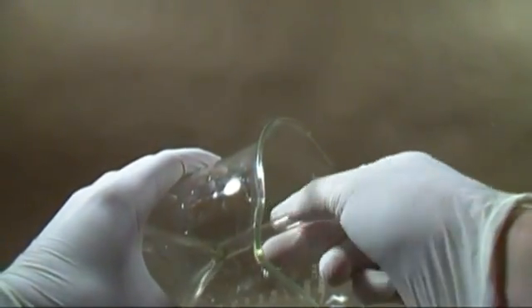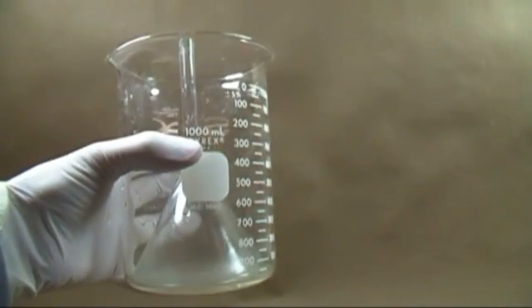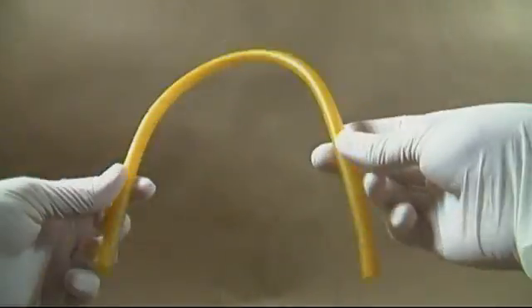It is important that the beaker diameter not be a whole lot larger than the funnel diameter, but you also don't want a tight fit. Last, you'll need some latex tubing.